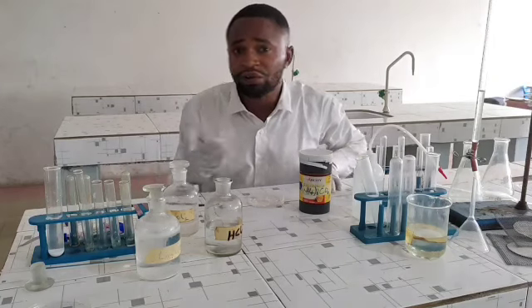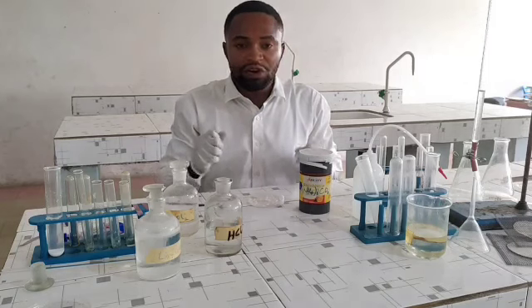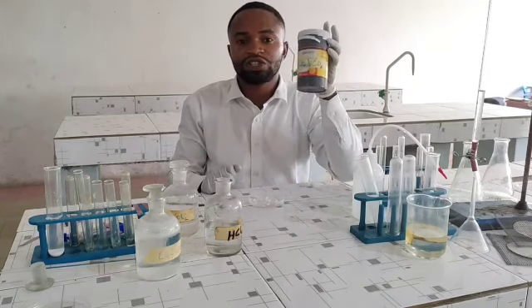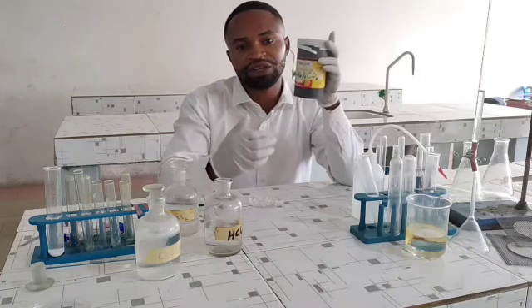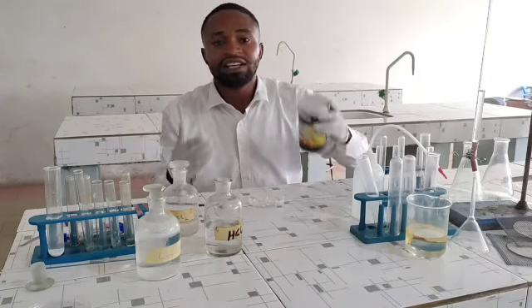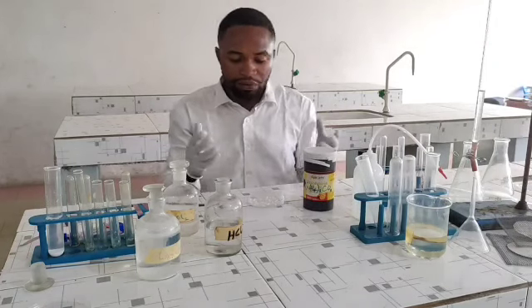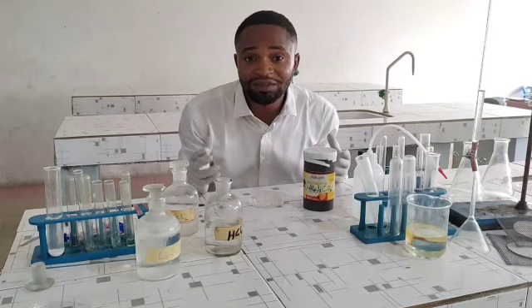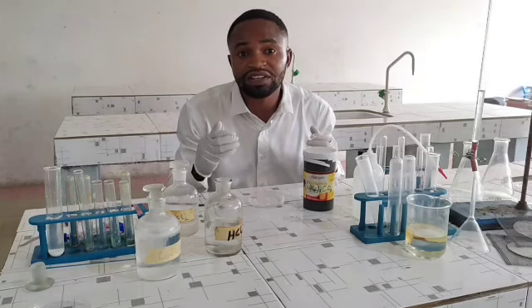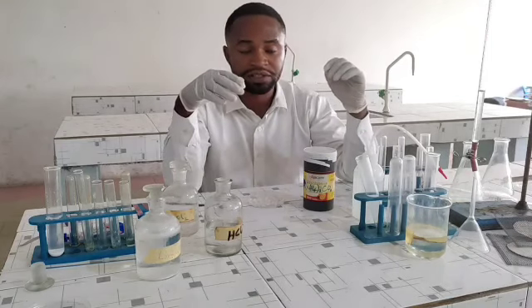Remember, in the exam, the examiner will not tell you the salt. He will tell you sample C. The examiner will say, C is an inorganic salt. Carry out the following tests on sample C. Record your observations and your conclusions. That's how the question is going to come. So, from the reagents given to you to test for this salt, you can carry out some necessary tests to confirm the ions present.